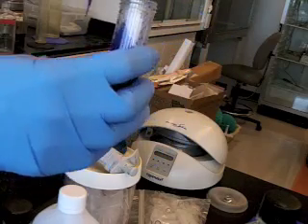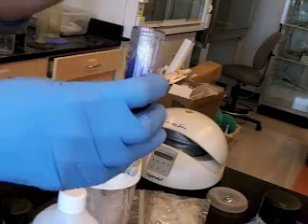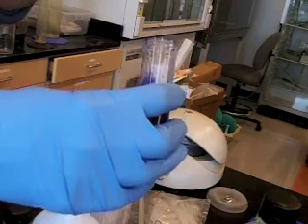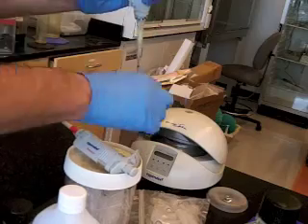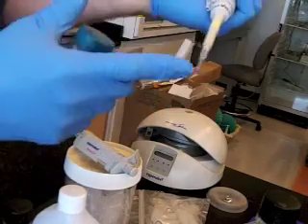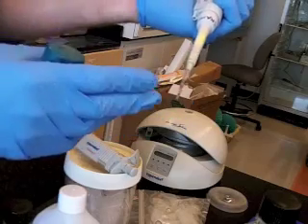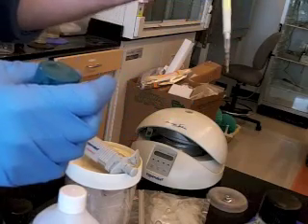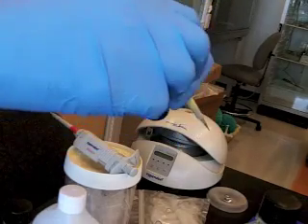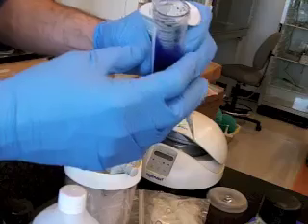Next thing is that, for pipetting, we are first going to set the volume. So we set the volume, then put a tip on, and the tip is sort of the last thing we'd put on. We want to keep this clean, so we'd put it on last when we're ready to pipette. And then we'd remove the cap of our tube. Again, keep these covered like that.